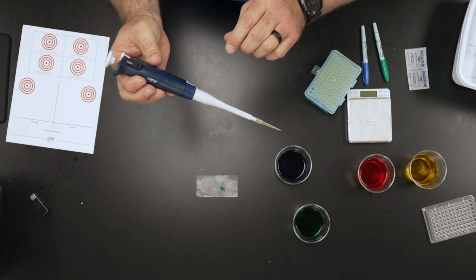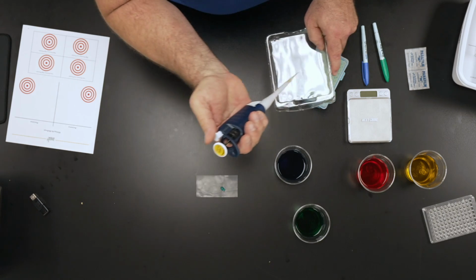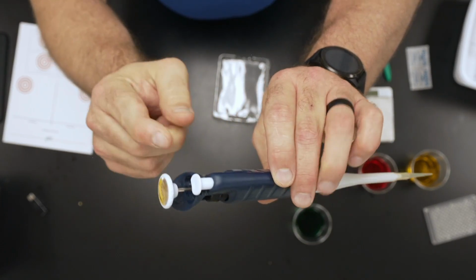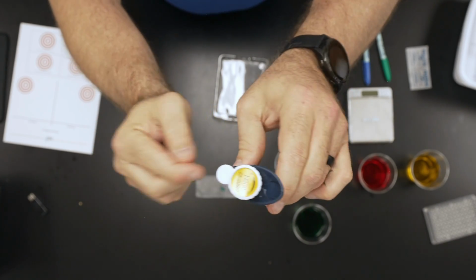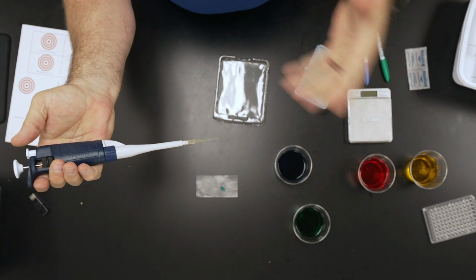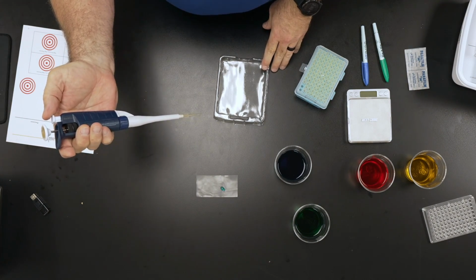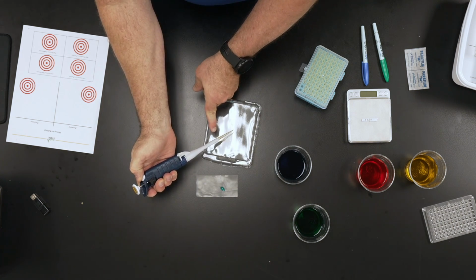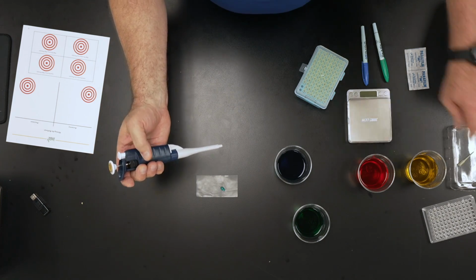So what I'm going to do is get rid of my pipette tip and get a new one. And how do I get rid of that pipette tip? It's very simple. This is the pipette expeller. So when I push this down, it's going to essentially push that pipette off. You don't necessarily want to use the pipette tip indefinitely because sometimes liquid will get stuck inside that. So I'm going to actually push that pipette plunger down. And if you look here, it's going to push that out. And I've got that essentially wasted pipette tip.